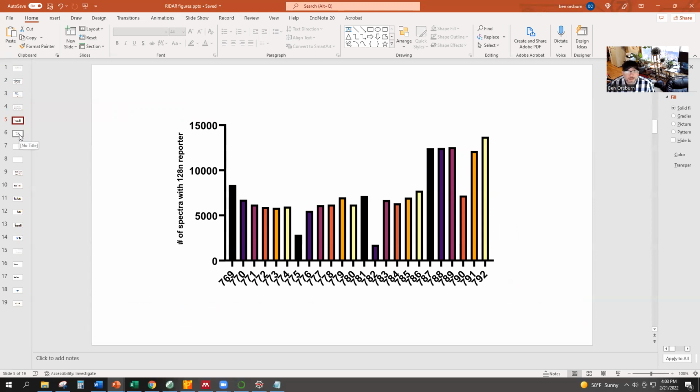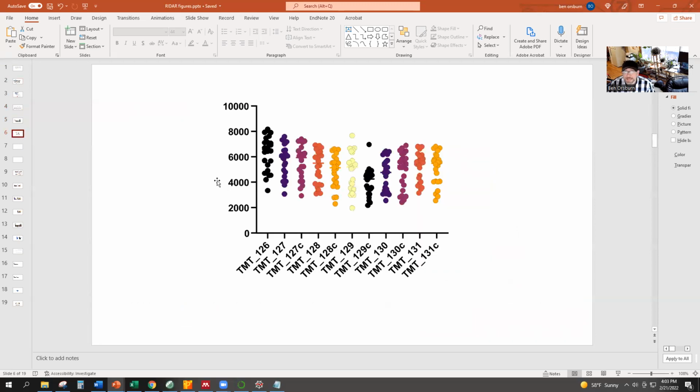And so that's basically it. Except we can look at intra-batch variability. Here we've taken all of the single cells and the number of spectra that they contain reporter ions from, from the SCoPE2 data set, from 25 or 50 files randomly chosen from that. And we can kind of see the intra-batch, inter-batch variability and other useful metrics from this.